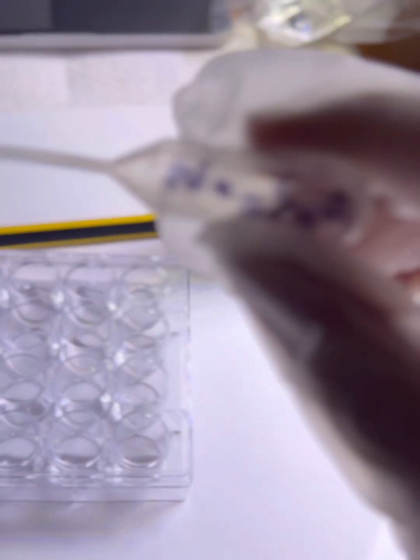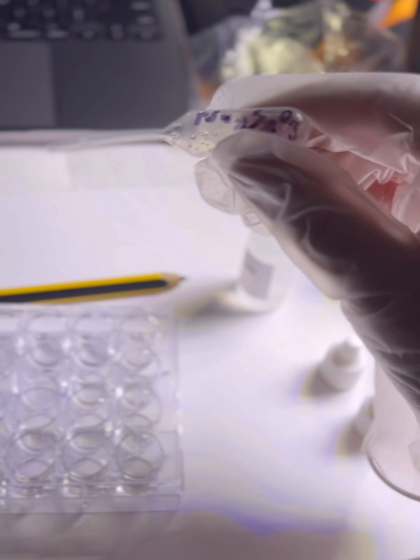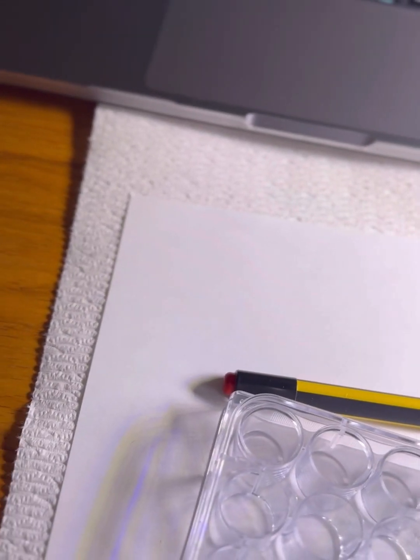So I've flipped the 24 well plate around, and I've labeled one of the pipettes as Na2S2O3. So now it says to slightly tip the 24 well plate forward so that the drops of rows A and B that contain Na2S2O3 pull together along the bottom rim. And it says to suck up the contents of one of these wells into the Na2S2O3 pipette.